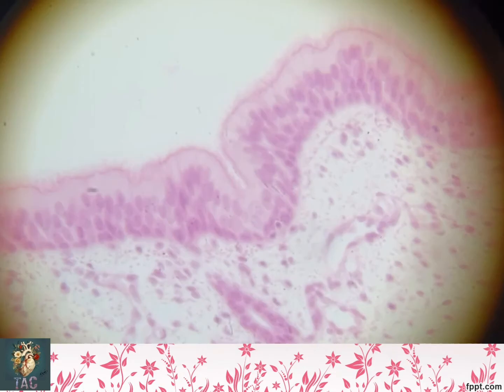Now look at this epithelium. This is the whole thickness of epithelium. First look at this thickness, that this thickness gives you an appearance of being stratified, although it is not. In a clearly stratified epithelium you will be able to see the clear levels of all the cells, but in this slide you can see the nuclei which are present at multiple levels. Also you can notice here a large number of cilia are present, and this line shows you the basal bodies which are forming the cilia. So this is pseudo-stratified columnar ciliated epithelium.